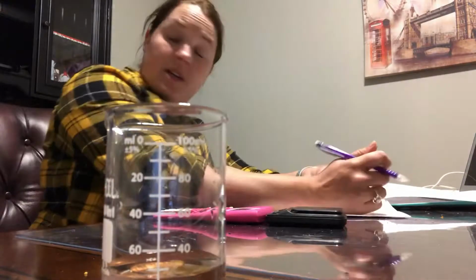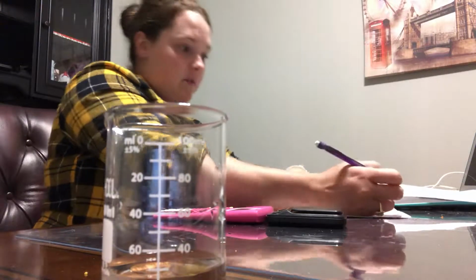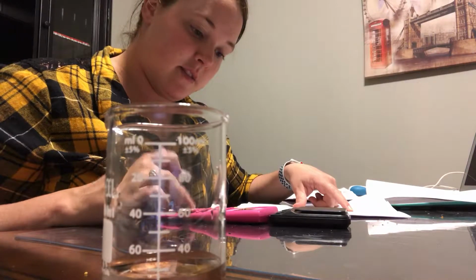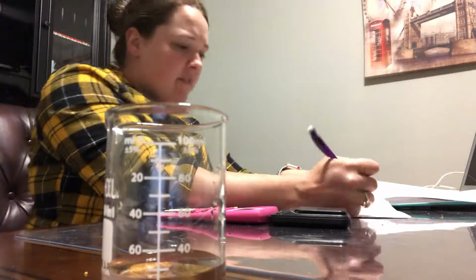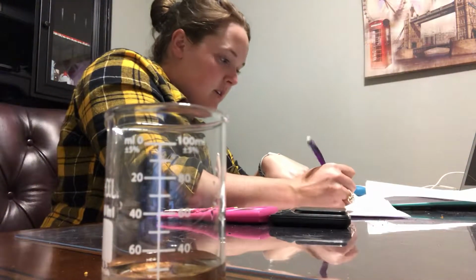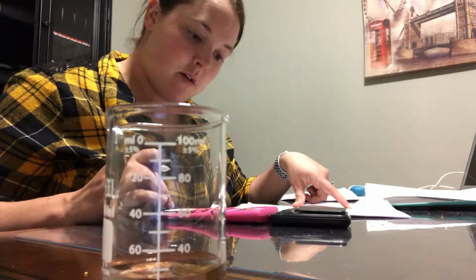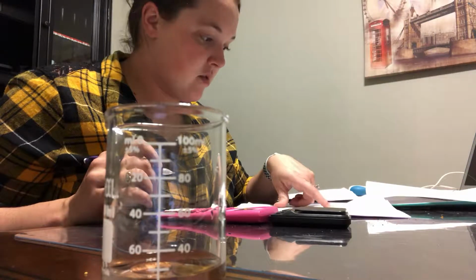And then this increased 1 milliliter. So I'm going to say it's increasing another milliliter because I don't have 5 more pennies. So we're going to say 27 milliliters is what it's going to go to. Then we divide the 39.36 by 27, and it's 1.457, so we'll do 1.46. Then B3 is 26.24 plus 13.12, so that's 39.36 this go around.